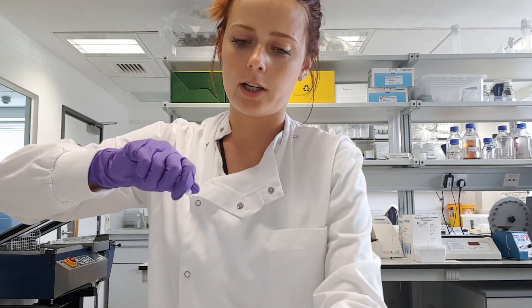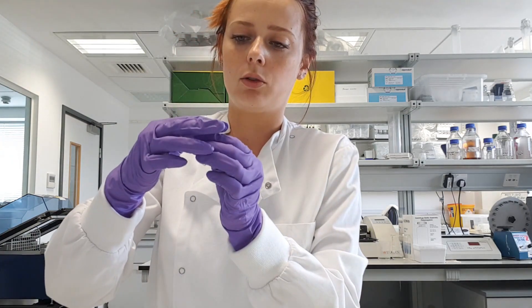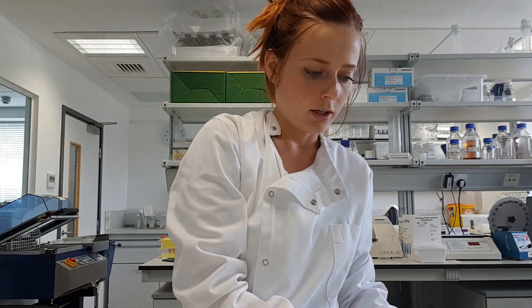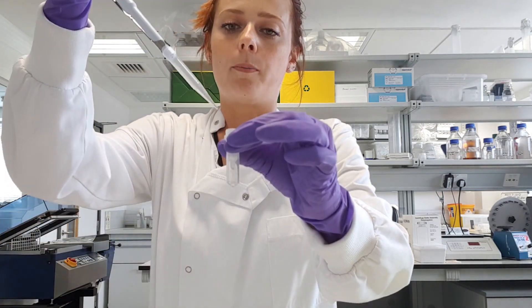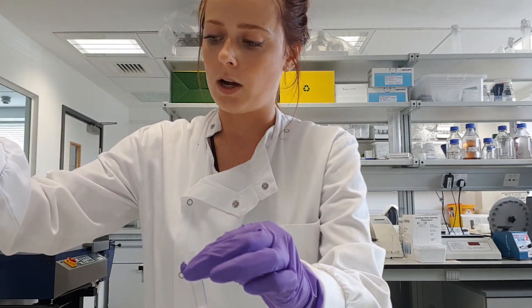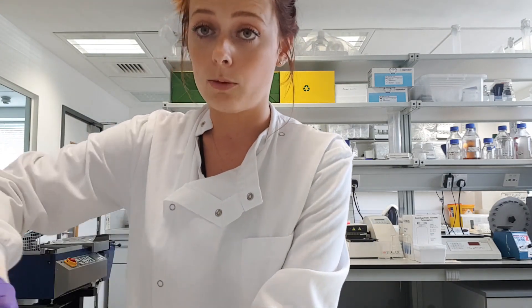I'm going to start by pulling out the plug, then opening the cap, and putting the column straight away into the waste tube. You will see that on the top of the column there is buffer remaining — the first step is to let that bed out. Do not hesitate to touch the top of the column; it will not damage it at all, and it's better to get all the buffer out than to risk contamination with your sample.